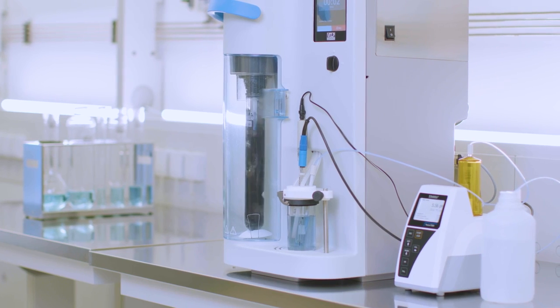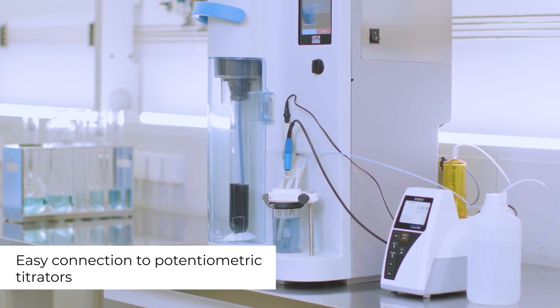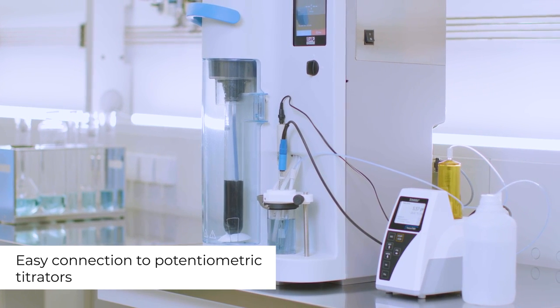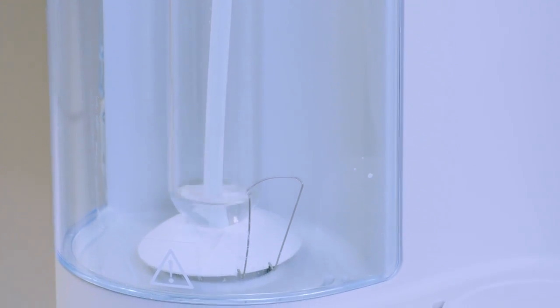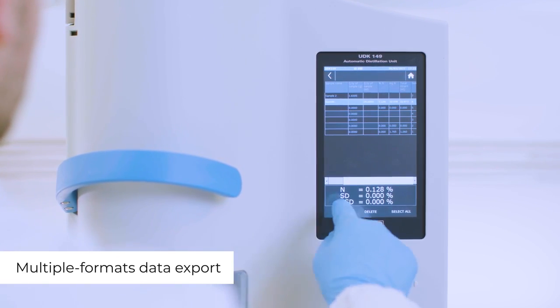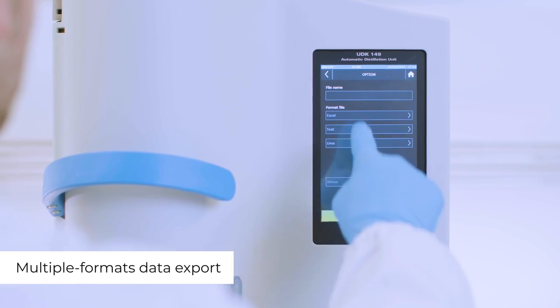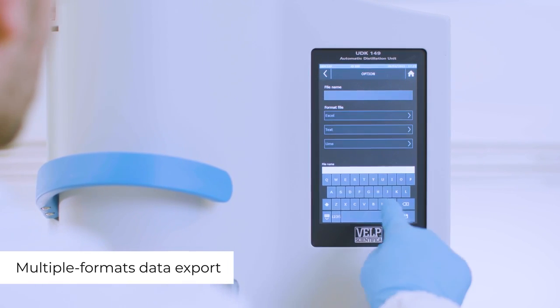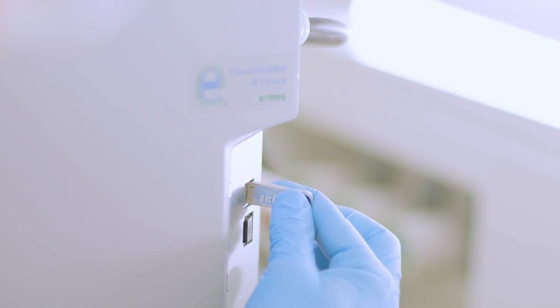The UDK 149 offers a connection to external titrators for the quantification of nitrogen and protein content. At the end of the analysis, automatic tube draining helps save valuable time. The UDK 149 stores the analysis results in the onboard archive. It is possible to export data to PC and LIMS in multiple formats via USB or Ethernet.